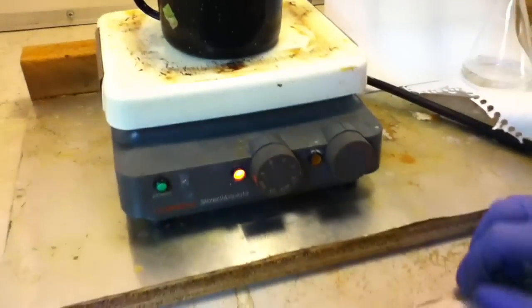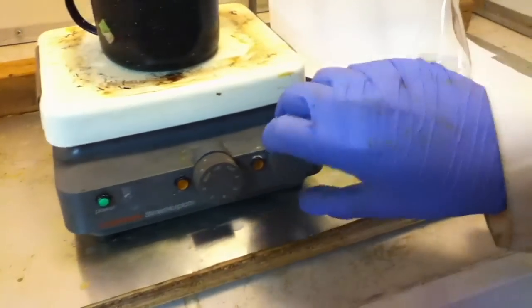Once the temperature reaches 64 degrees, turn off heating and disassemble the apparatus.